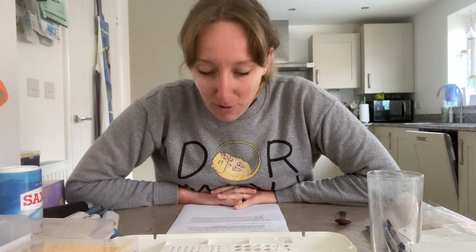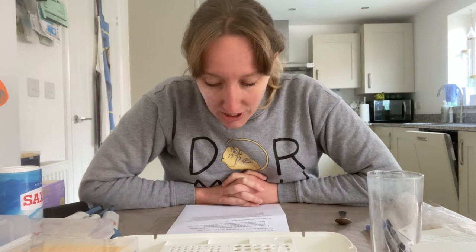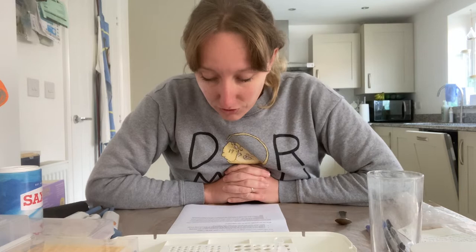I'm going to read a little bit from our website about this experiment. I'm going to extract DNA from my saliva and then look at what variations I have of the ACTN3 gene. This gene encodes the alpha-actinin-3 protein, which is present in skeletal muscle and is essential for its contraction. You get two copies of every gene, and this gene can be one of two variations: it can have a T allele or a C allele. The C allele is apparently associated with full-power skeletal muscle contraction due to fast-twitch muscle fibres, which means the person could be an excellent sprinter.